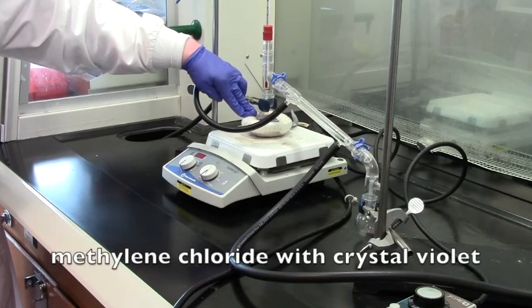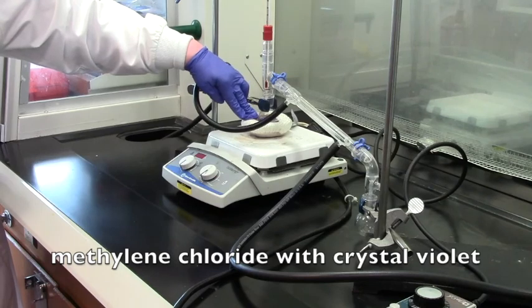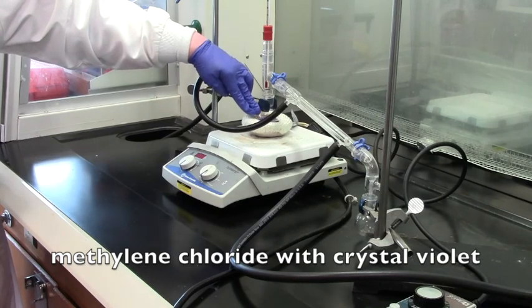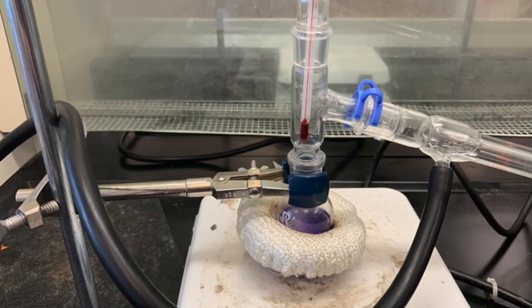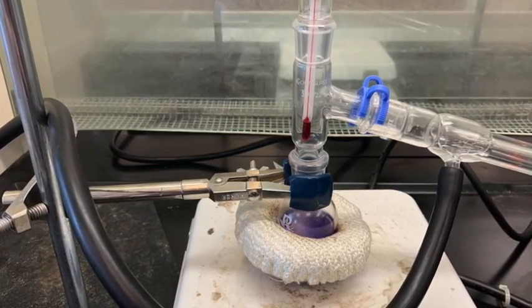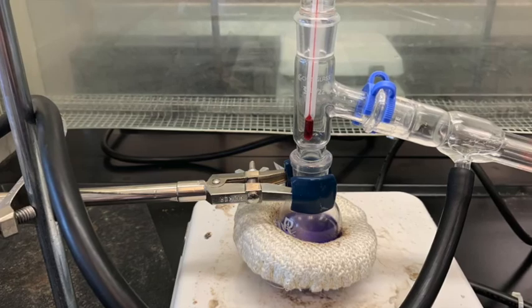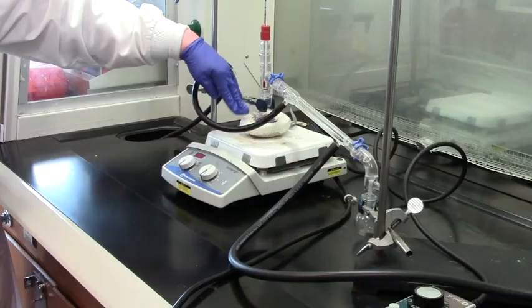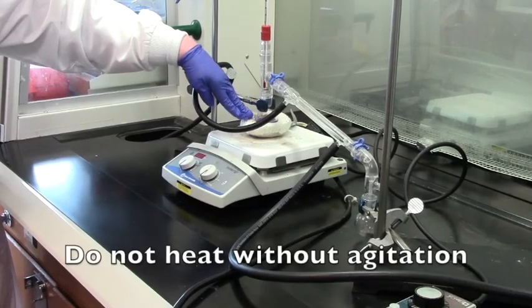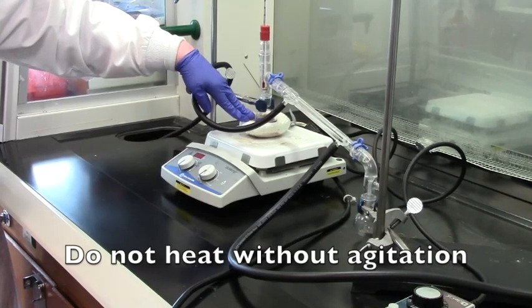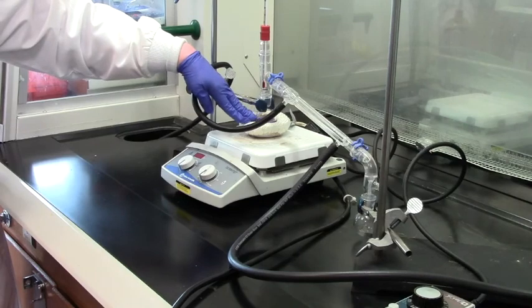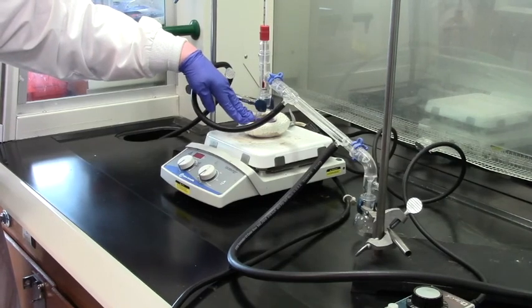is a mixture of methylene chloride with crystal violet, and it's a purple solution there. Inside this flask, I also have about two to three boiling stones, because when we heat this up, we really don't want to heat anything without some type of agitation, whether it would be boiling chips, boiling stones, or a magnetic stir bar.